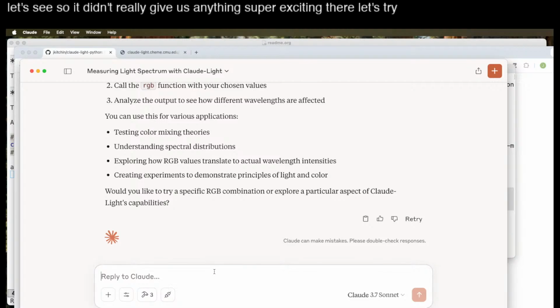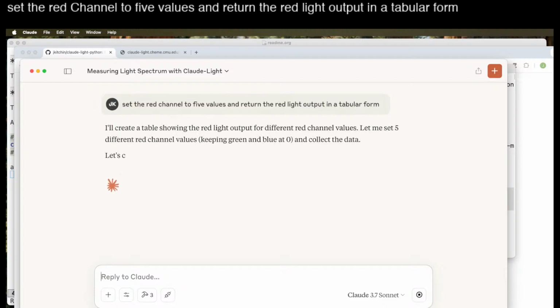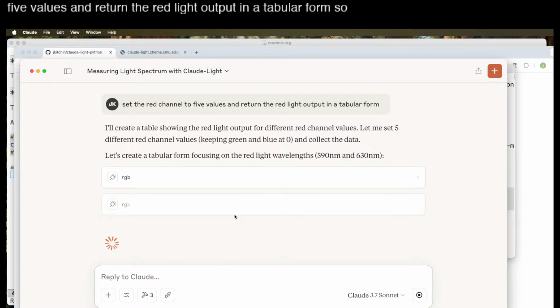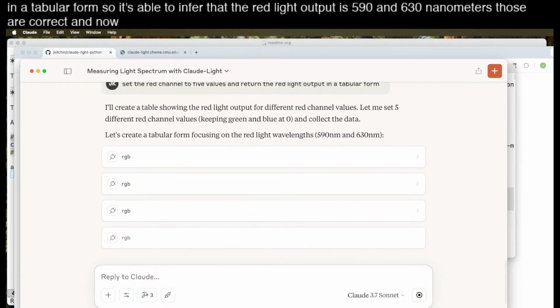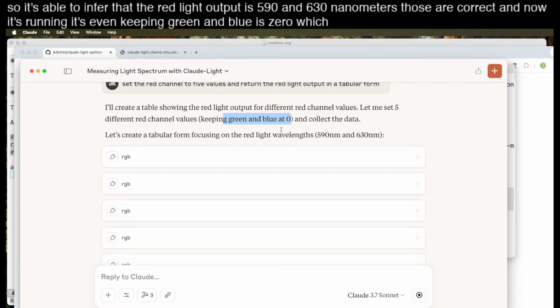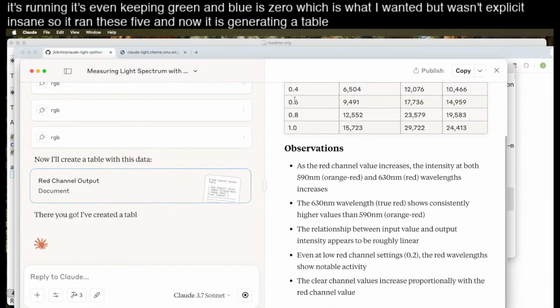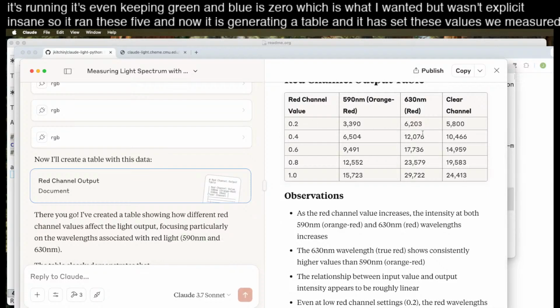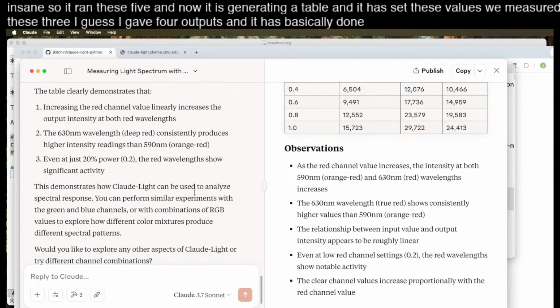Let's try this. Set the red channel to 5 values and return the red light output in a tabular form. So it's able to infer that the red light output is 590 and 630 nanometers. Those are correct. And now it's running, it's even keeping green and blue at 0, which is what I wanted, but wasn't explicit in saying. So it ran these 5, and now it is generating a table, and it has set these values. We measured these 3, I guess it gave 4 outputs, and it has basically done the experiment that I wanted.